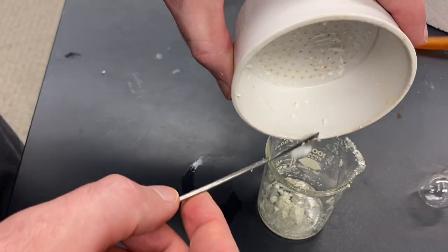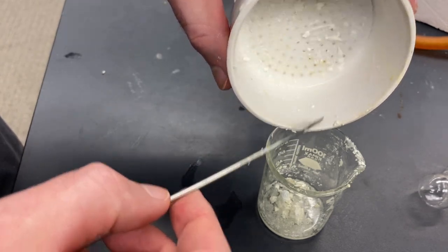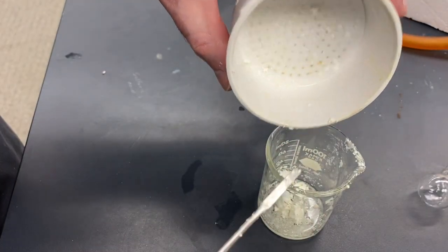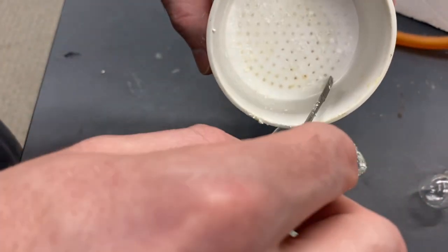And I think I'll just put the stir bar in there too, and we'll fish it out once everything is dissolved. So I'm getting all of this — I'm just scraping this off of the filter paper.